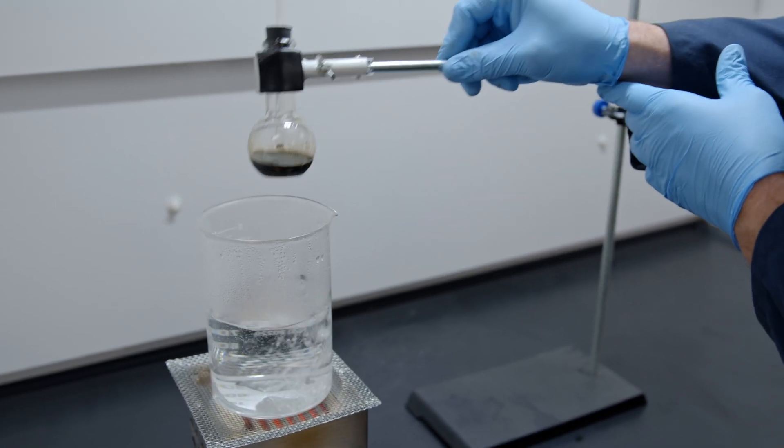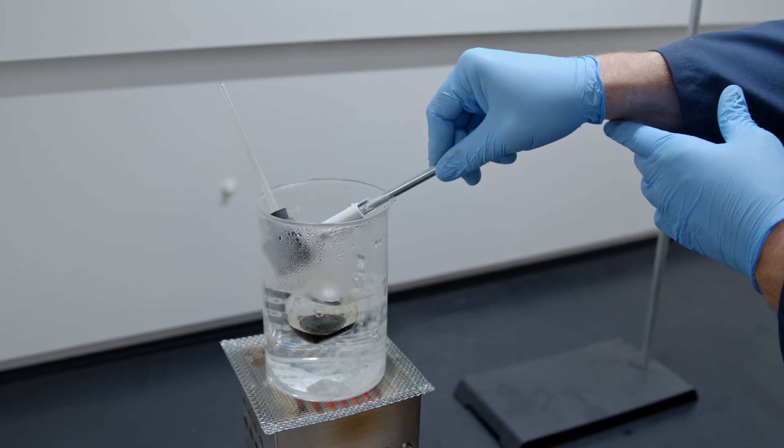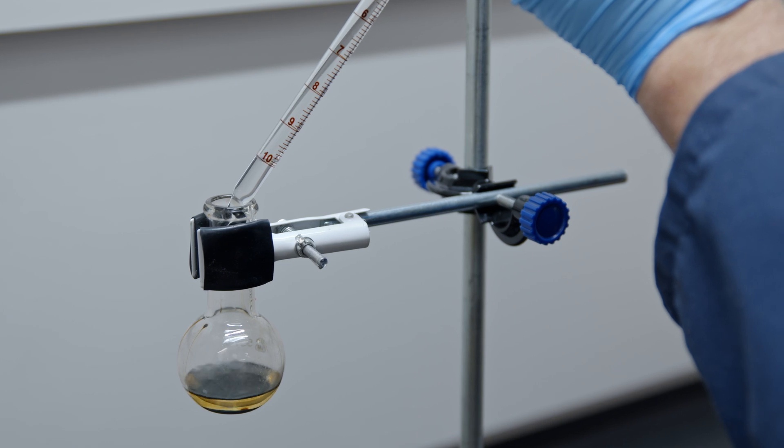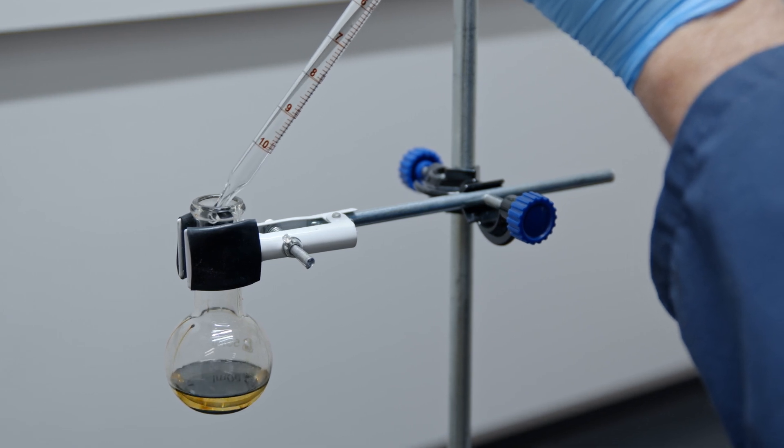If the test results are disputed, use the same sample and repeat the test from the beginning. Replace the loss of solution from testing with additional solvent.